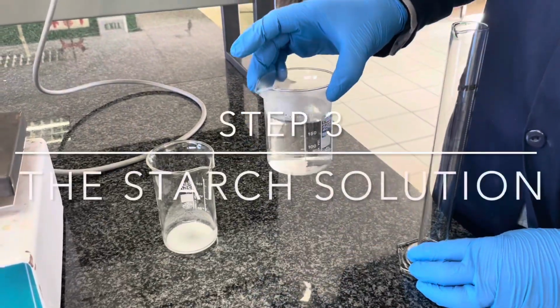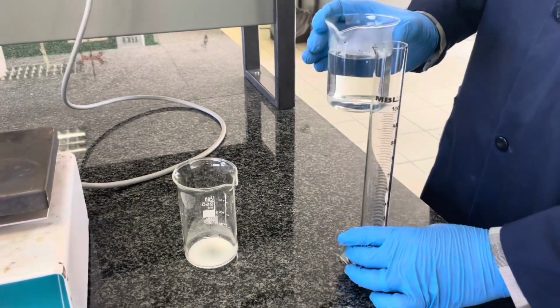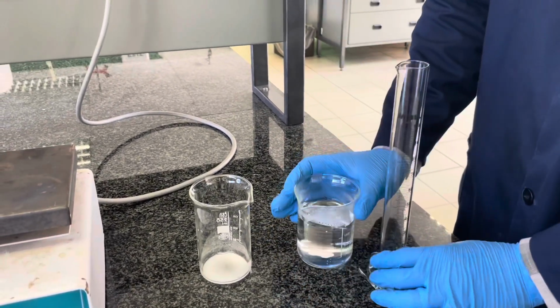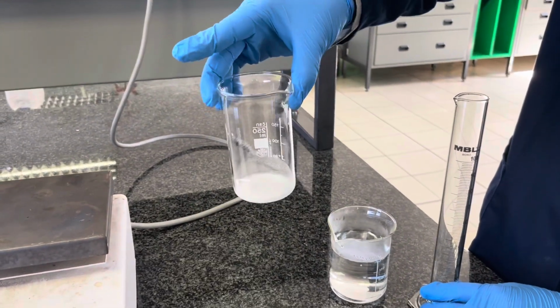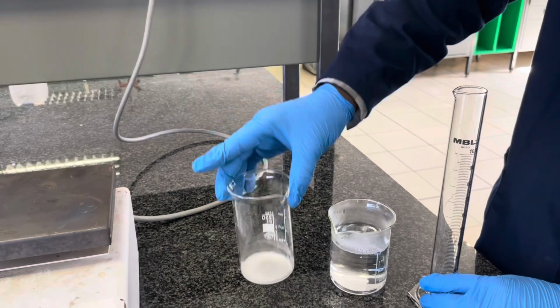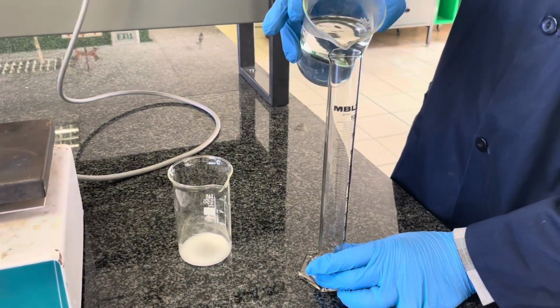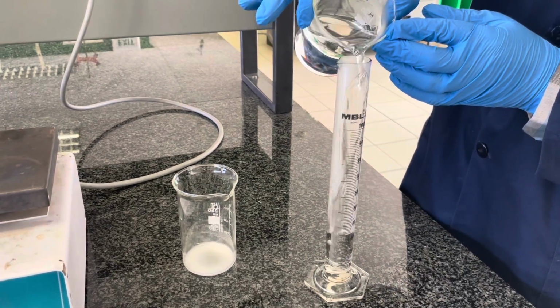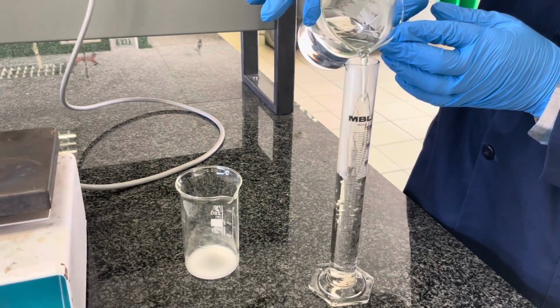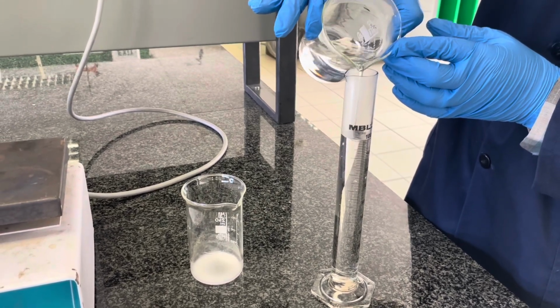Our next step is to prepare the starch solution. Take your 1 gram of starch, which you have made a paste with some cold water, and to this we're going to add 100 milliliters of boiling water, which you've collected from a kettle. To measure the 100 milliliters of boiling water, use a measuring cylinder to transfer the water from your beaker to the mark on the measuring cylinder.